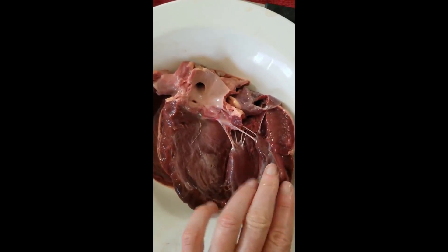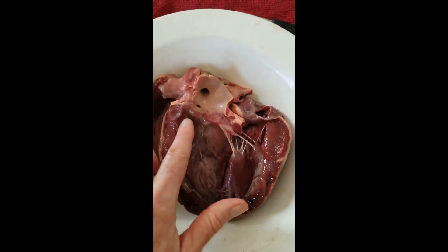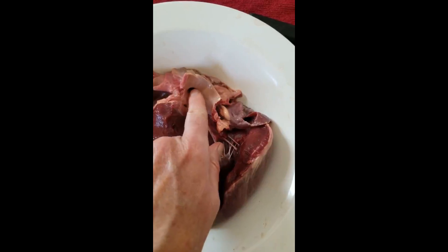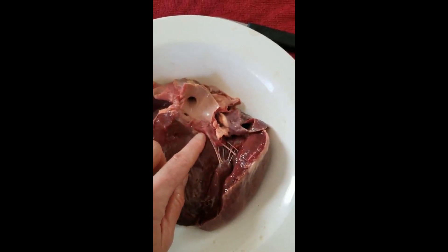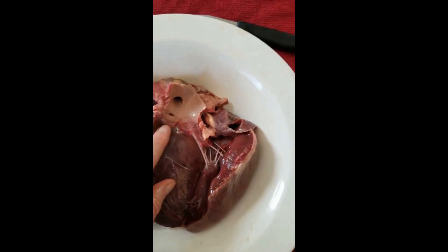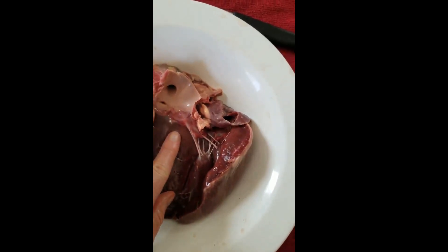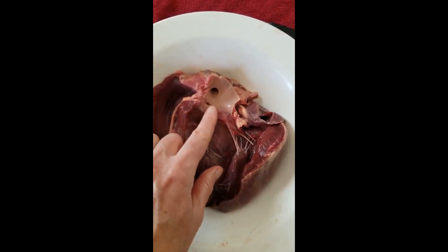We're back on the left side of the heart — all left ventricle here. You can see the bicuspid valve, chordae tendineae, and papillary muscle again. This is the aorta — I've cut it open and laid it flat. You can see one of the openings; there are actually three major blood vessels that branch off at the top of the aorta. We're looking at the aortic valve, which separates the left ventricle from the aorta. You can see the little flaps — two of the three scalloped flaps of the aortic valve are visible here.